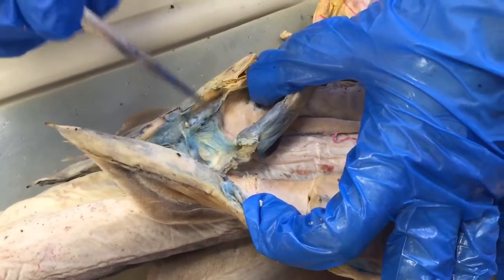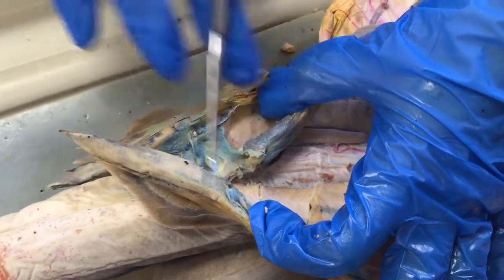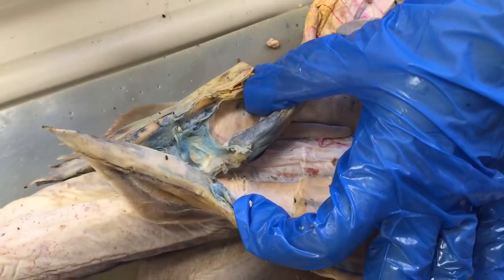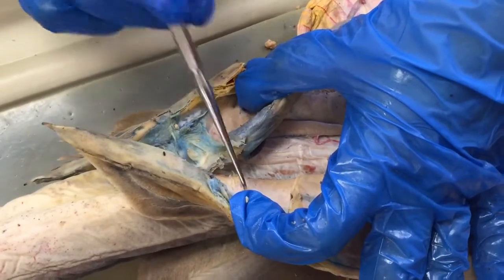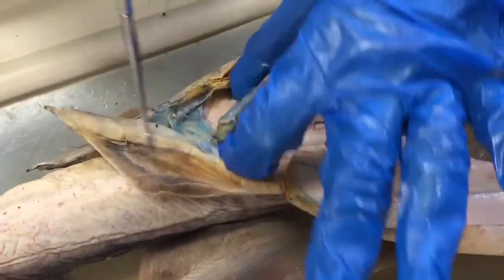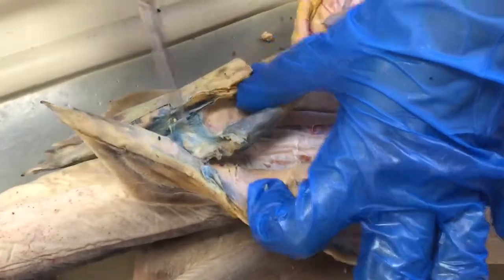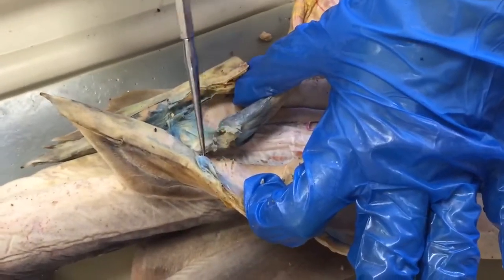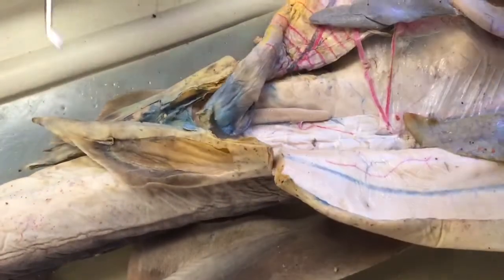The reason this is called the iliac artery: remember back in the skeletal section, in the hip area you had the ilium, ischium, and pubic bone — so that's why it's called the iliac artery. And obviously the main bone associated with the hind limb is the femur, so that's why this is called the femoral artery going to the pelvic fin.